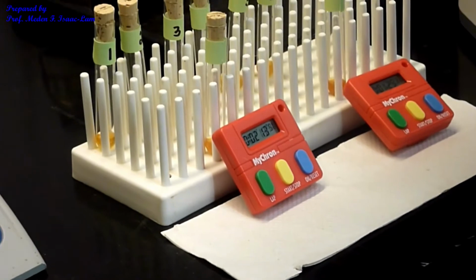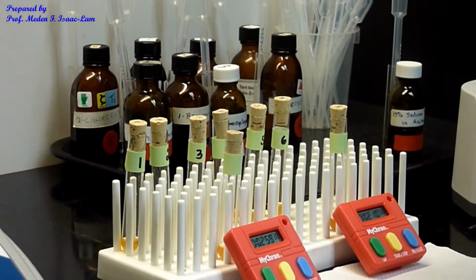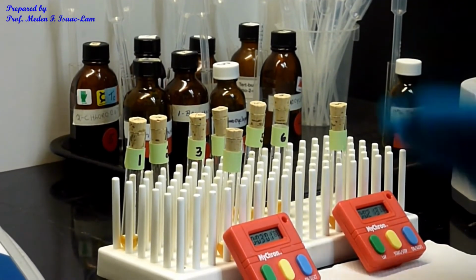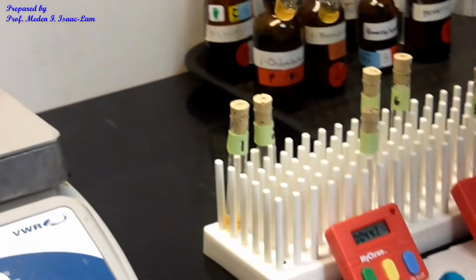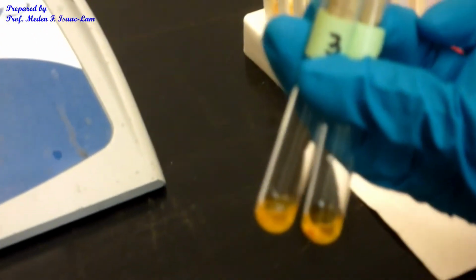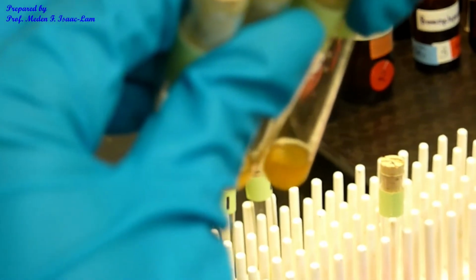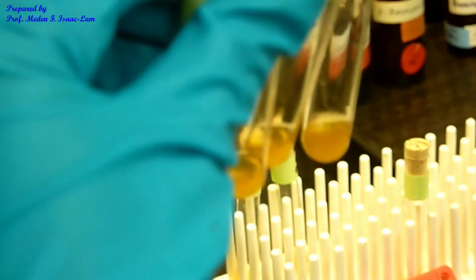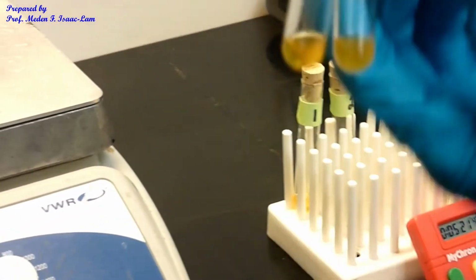Okay. So when it's done at 5 minutes, I let it sit for another 5 minutes so that we can compare. So obviously all of it should have reacted by now at room temperature. And so if you compare 3 and 4, and then 5 and 6, they're very similar. There's slight precipitation at the bottom, very slight, and they're almost equal. And then we're going to heat those up, see if we can make it precipitate more.